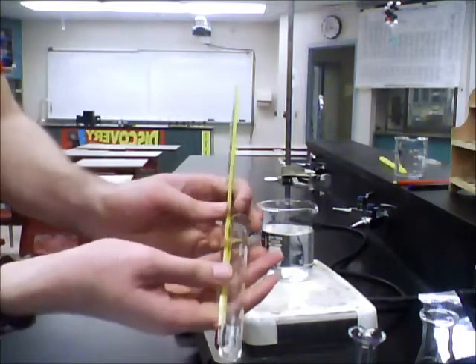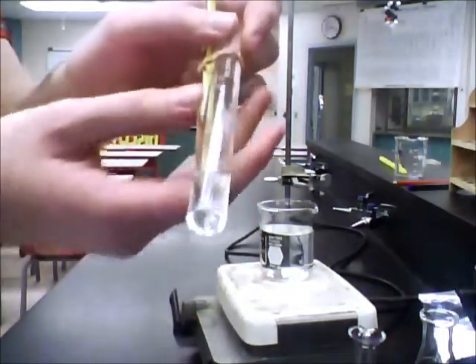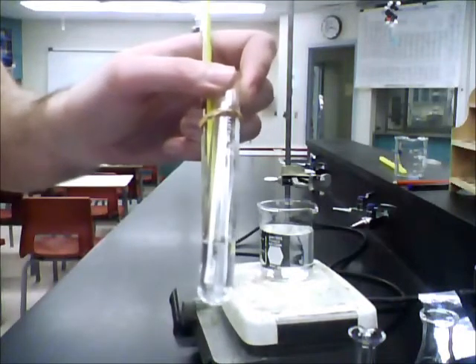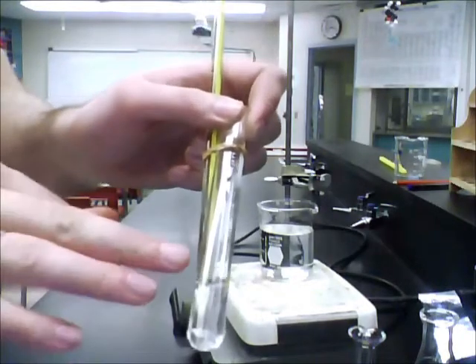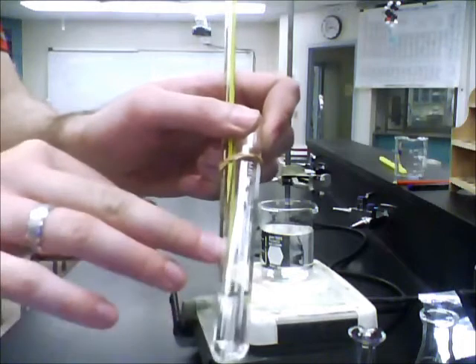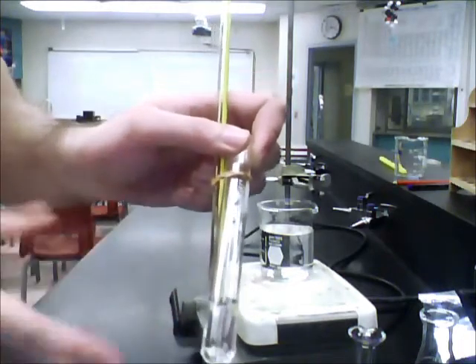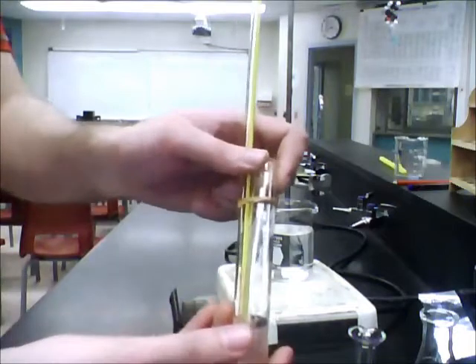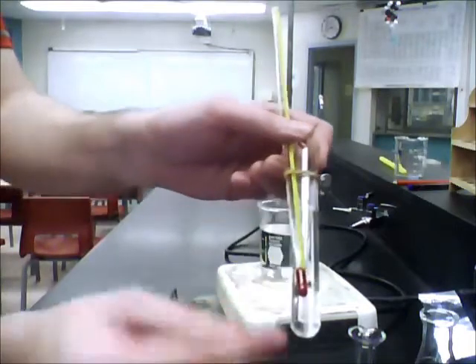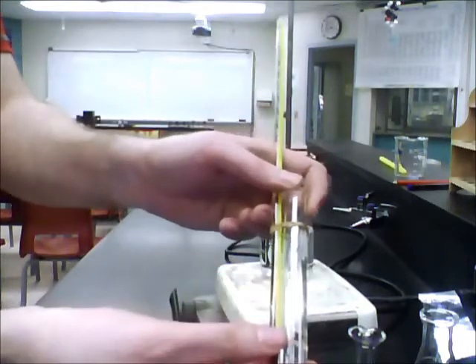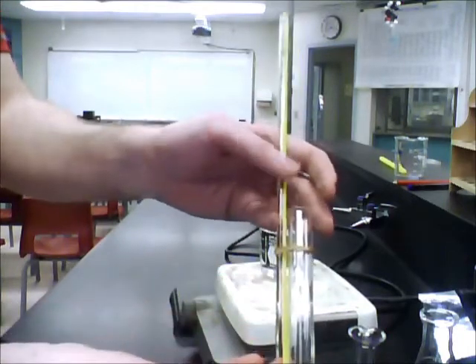What I did was at the very bottom, I put some of our alcohol that we're going to be testing. As I mentioned, it's going to be methanol. Inside, you notice a little tiny glass rod and that's going to be our capillary tube. I'll show you how to set up the capillary tube later on, but all you need to know is we're putting the capillary tube in with our alcohol and we're going to secure our thermometer with the rubber band.